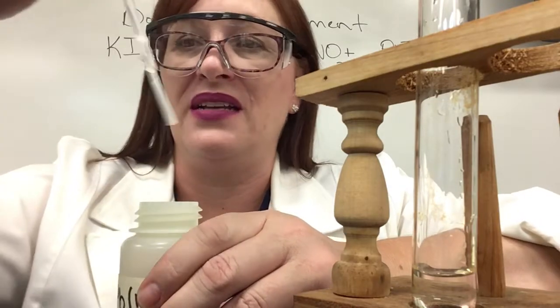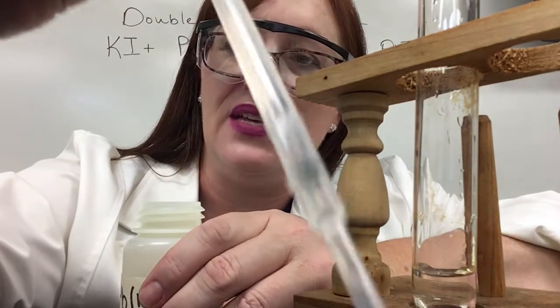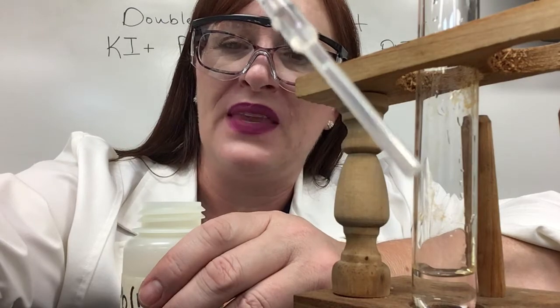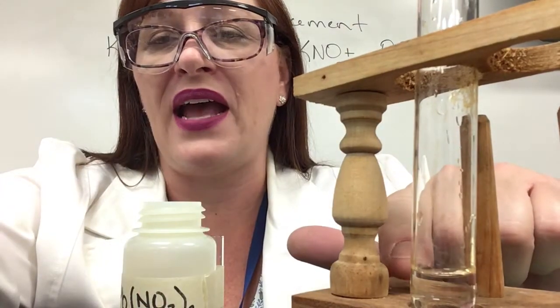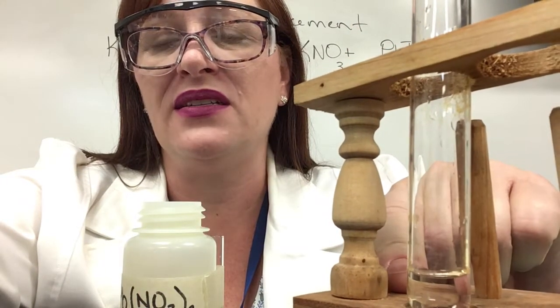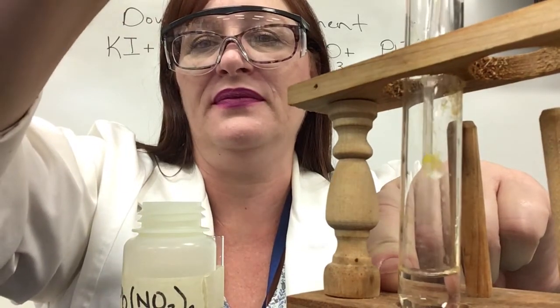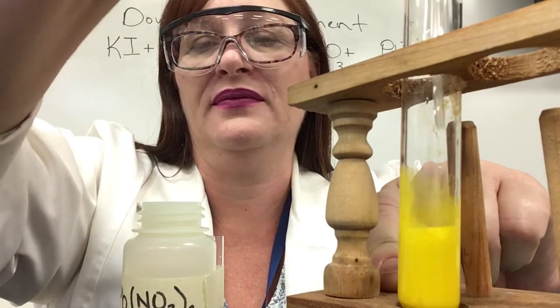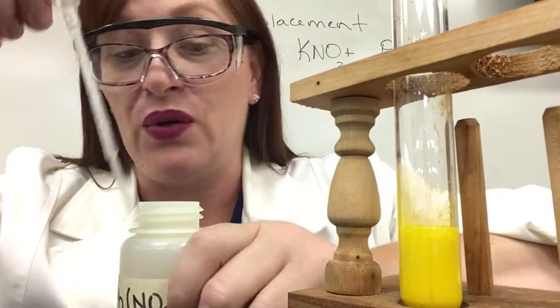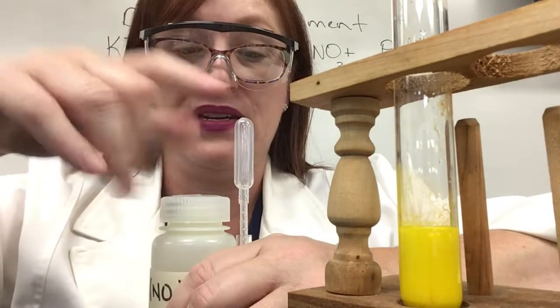So far not so exciting. Here's what the lead nitrate looks like — perfectly clear. But something really cool is gonna happen. Watch the bottom of this test tube when I put this squirt in. Wow, that's a big color change isn't it?